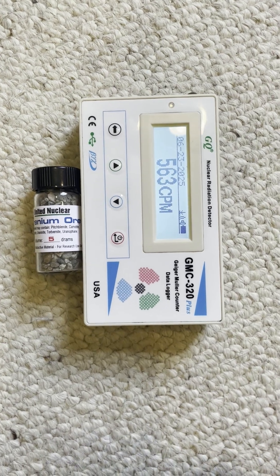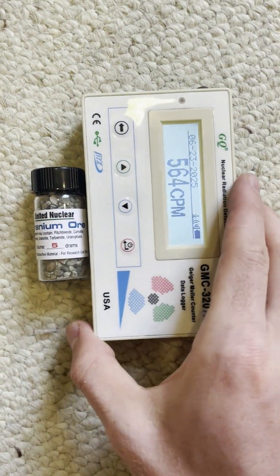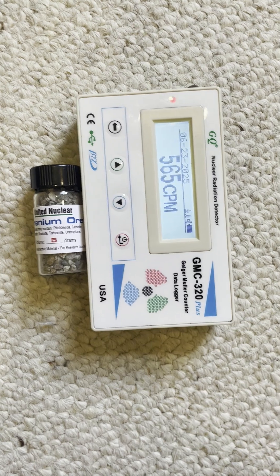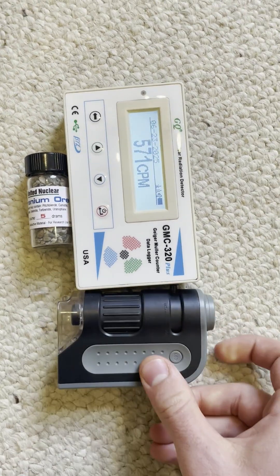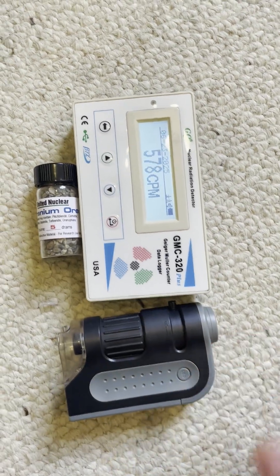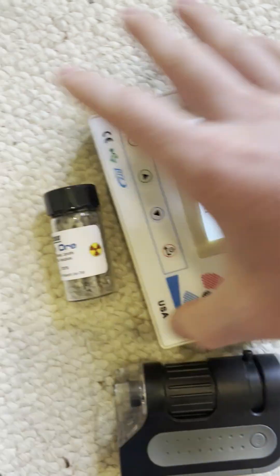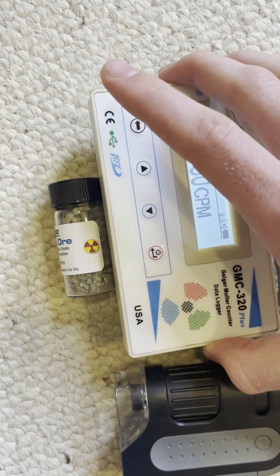I like my uranium ore — it's really neat and just awesome — but I also like my microscope. So I decided, let's look at the uranium ore under my microscope.